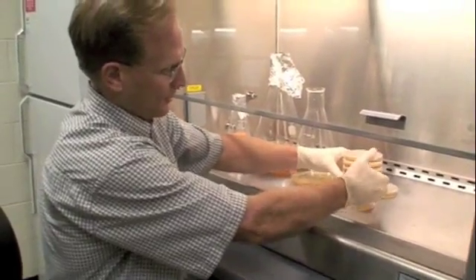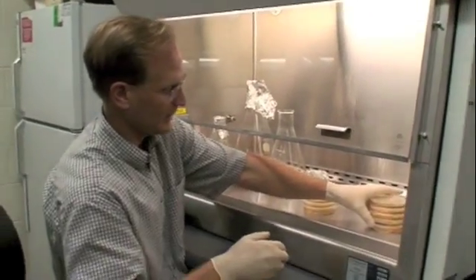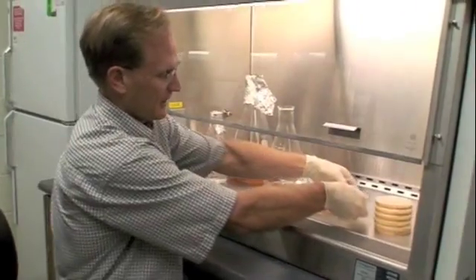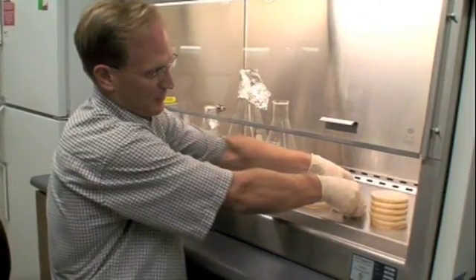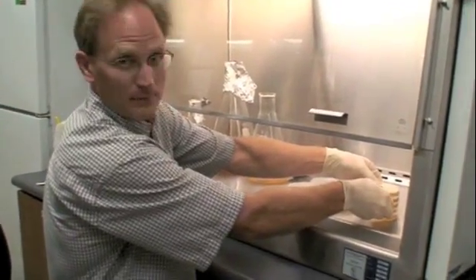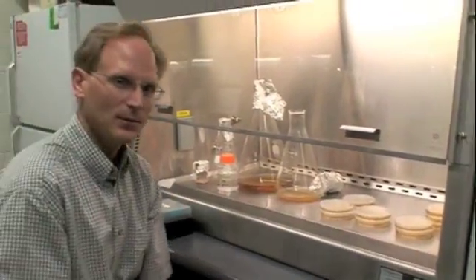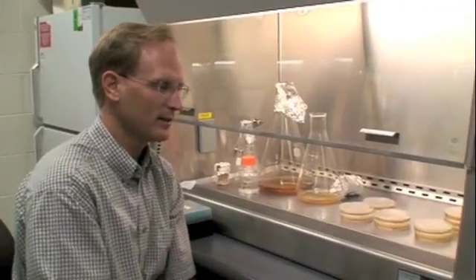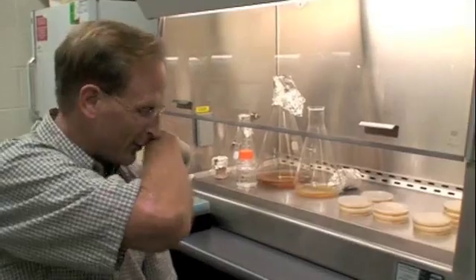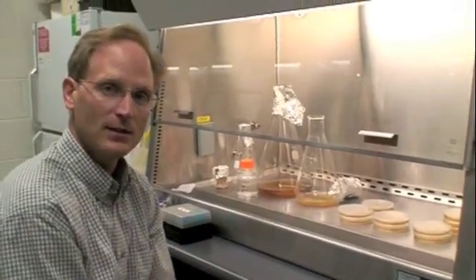Ideally, because I want them to cool, I'm spreading them out a little bit. I just have to be careful, otherwise they'll just end up making a mess. But I'm going to put them two to three deep, and we'll let them sit for 15 to 20 minutes. Let them cool like this, and then they'll harden a little bit, and we'll put on the X-GAL and IPTG.